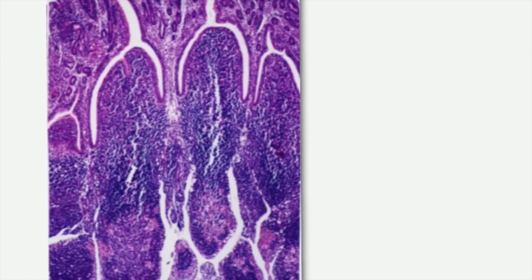This is the picture for the appendix, which is one of your histological slides, glass slides. And this appendix is of a rabbit. Why? Because it has a characteristic inverted Y-shaped crypt. This is a crypt, and it is branched like this, looking like an inverted letter Y. And as you see here, we have the lymphoid tissue well developed in the mucosa and passing to the submucosa, and it is present all through the circumference of this organ.